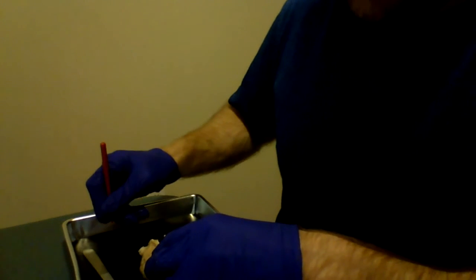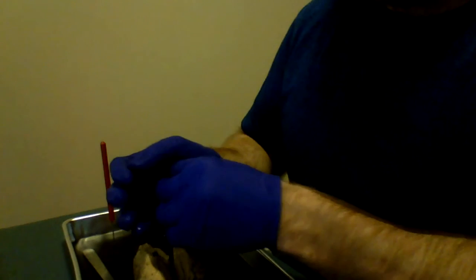So that is the sheep brain dissection video. Take my gloves off here, and we can see I've got some experience with this.